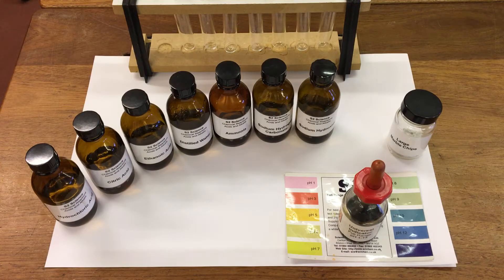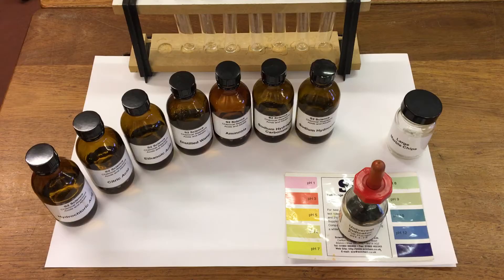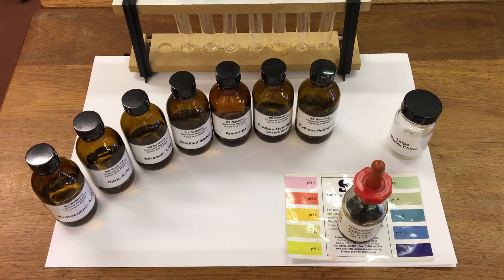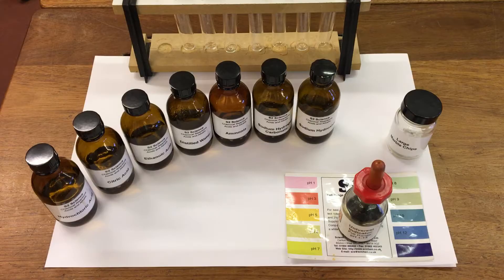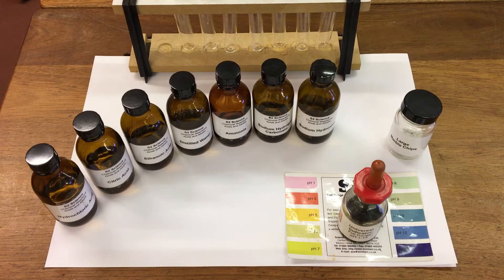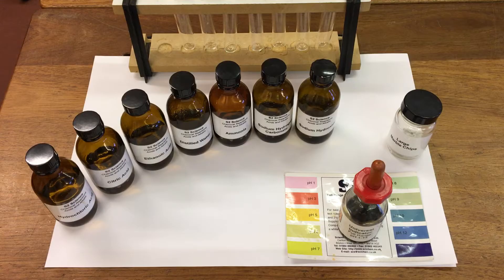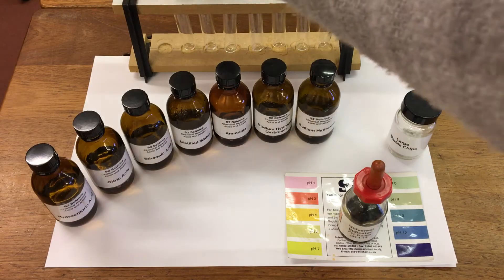In this experiment we're going to look at the reaction of acids and alkalis with universal indicator. I'm also going to add a marble chip to see if we get any reaction. So first of all we're going to take five mils of each solution and pop it into a test tube.